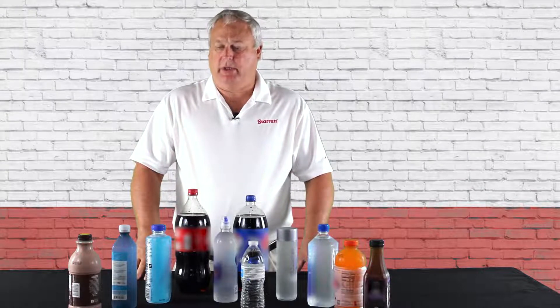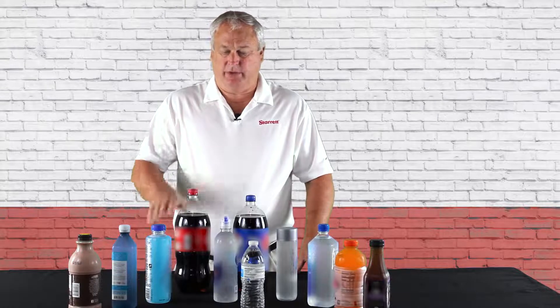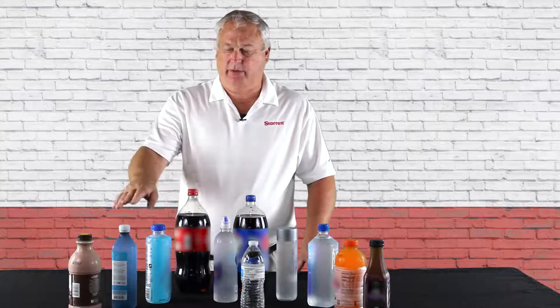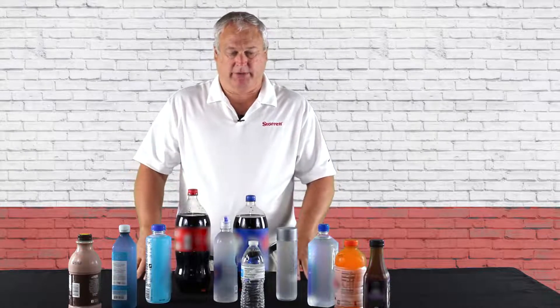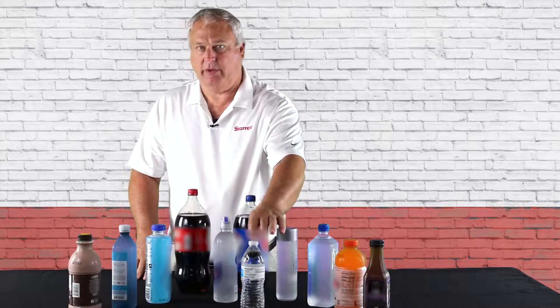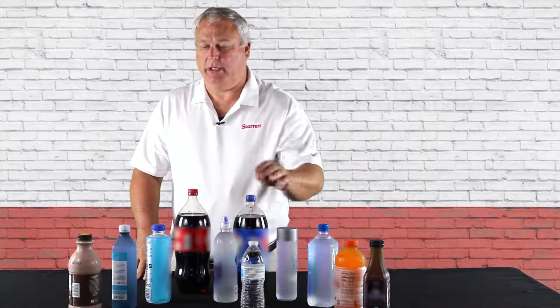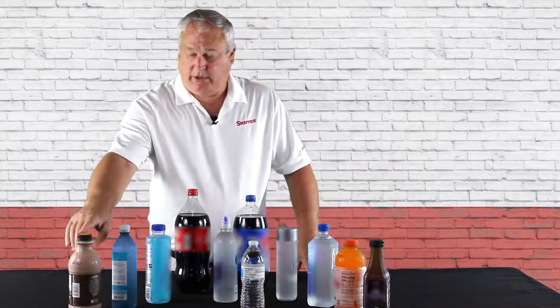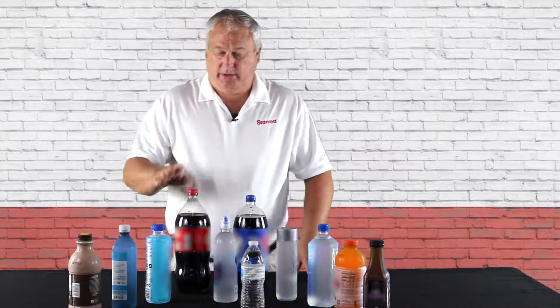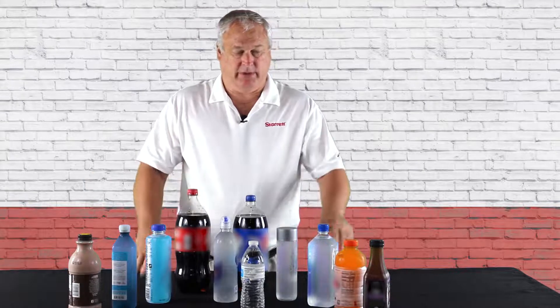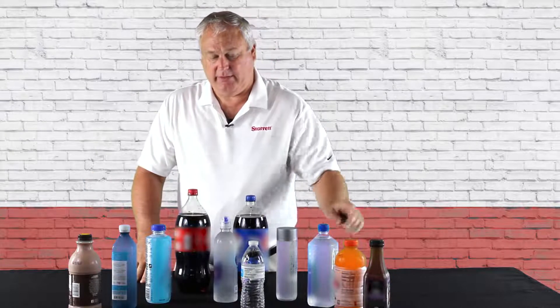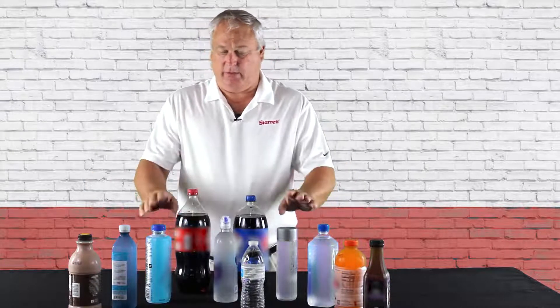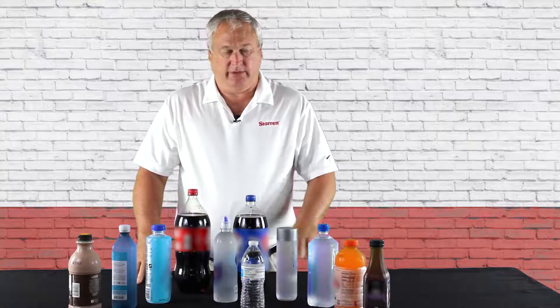We've got quite a variety of bottles here from your two liters to your smaller bottles, your individual standard water bottle. We have chocolate milk, carbonated beverages, sports drinks, and iced teas.